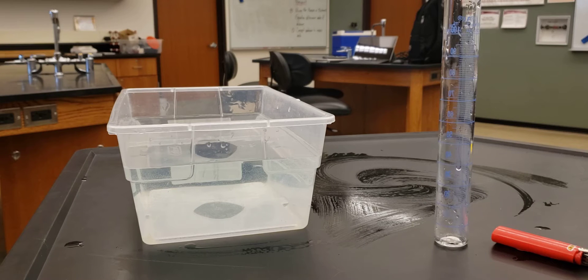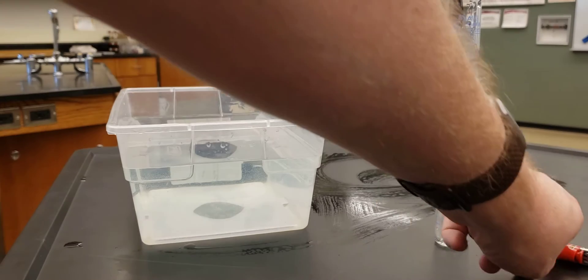Okay, so for today's lab, we're doing the molar mass of butane. For the molar mass of butane, we need a few materials.